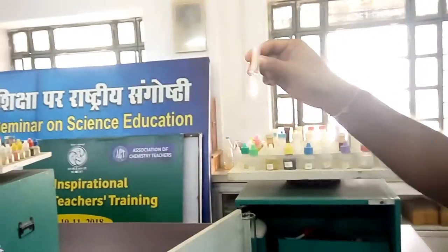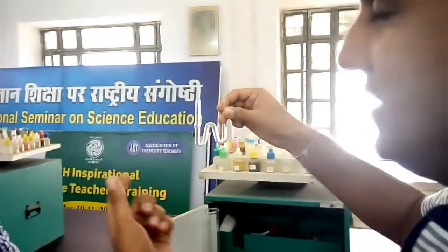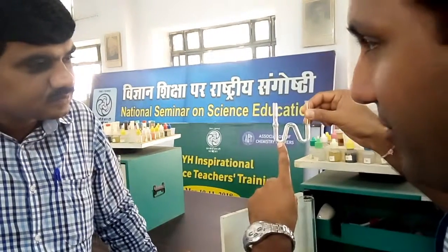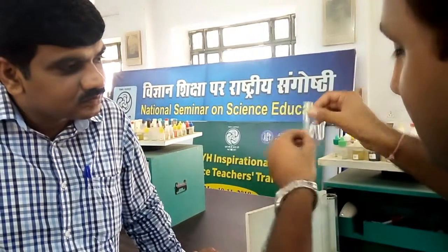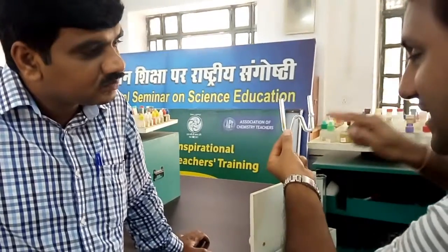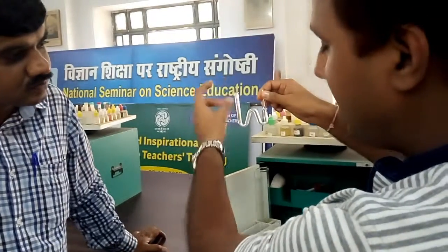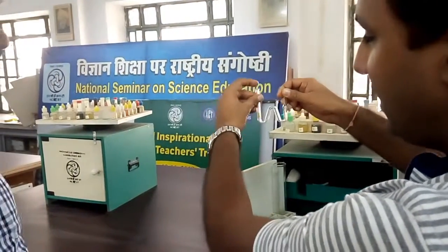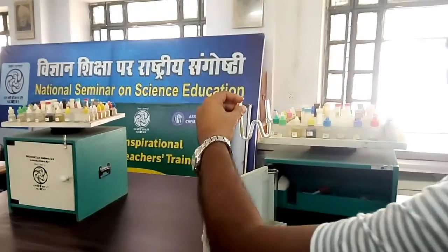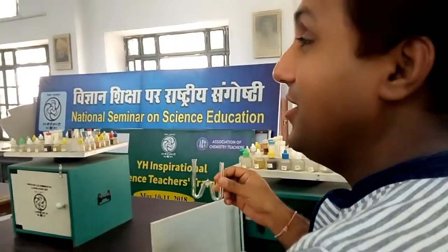These small beakers — we call this the W-tube. Suppose you want to test for CO2 gas generation. You put sodium carbonate or sodium bicarbonate on one side and add HCl, so CO2 is generated. To test this, you put lime water on the other side. After adding a drop of HCl, the gas passes through the lime water and turns it milky. I have published a paper where I generated all the gases this way.